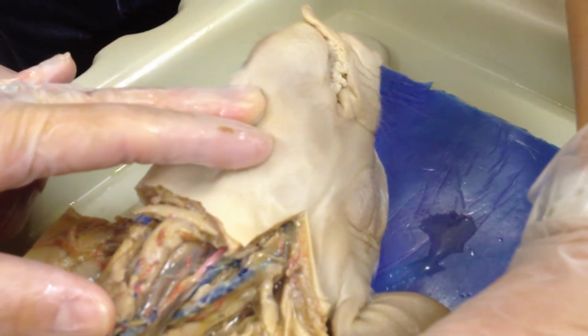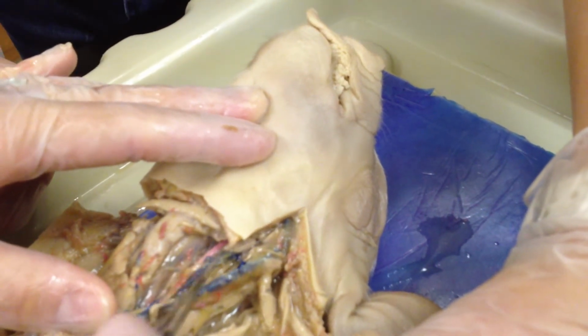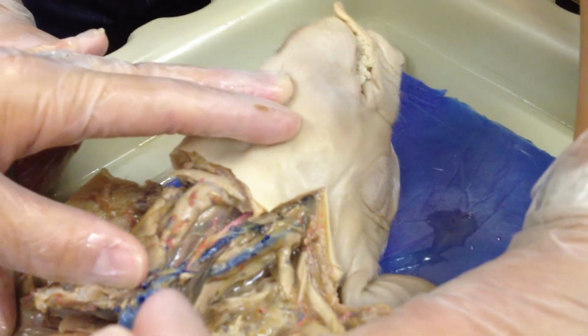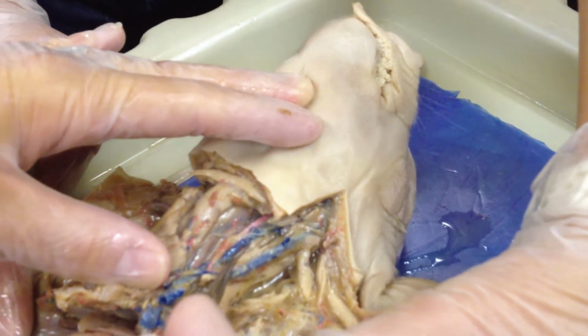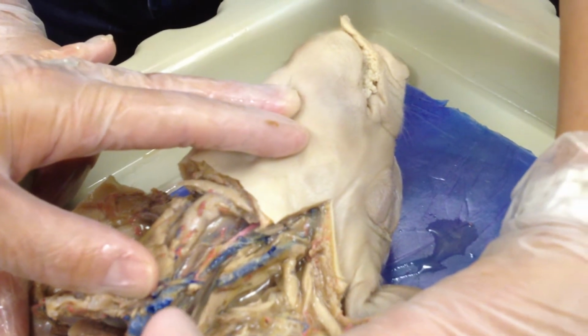It's really closely attached to the internal jugular vein. You've got an external and an internal jugular, so that's your common carotid. The next one is jugular vein. Did it specify external or internal? No. If it's in the neck and I tag it and it's blue, I stick a pin in it, you call it the jugular, we're good with that, okay?